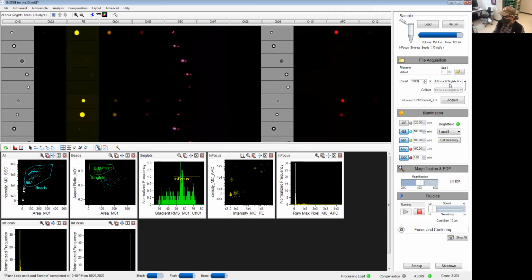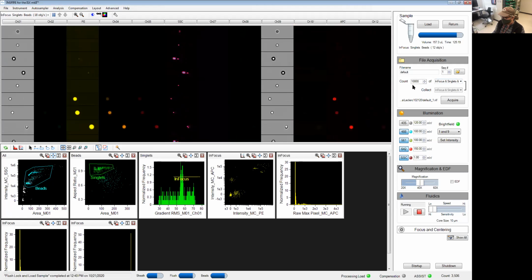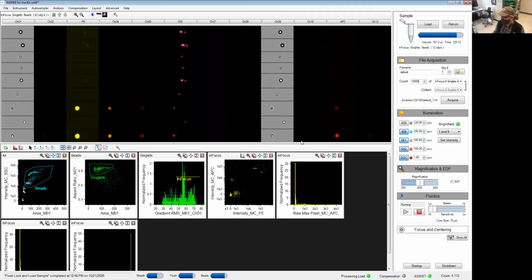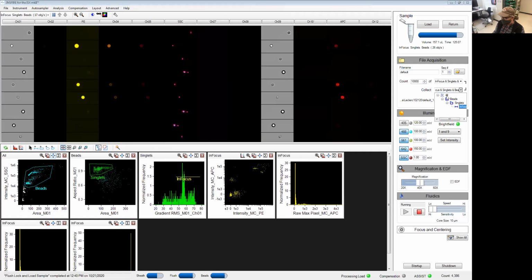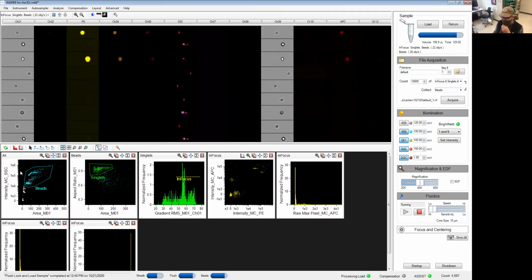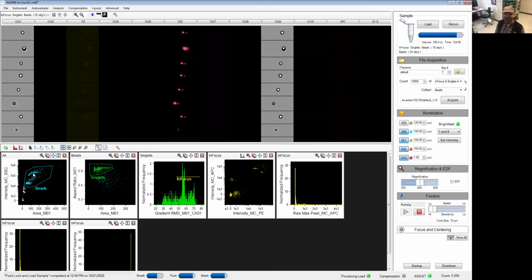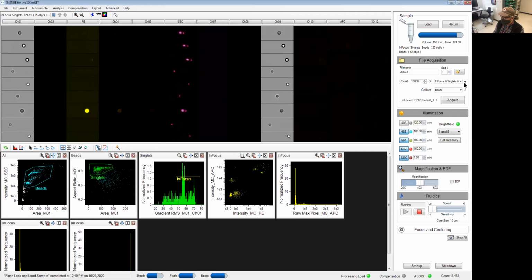Collect, since these two boxes are linked, we're going to count 10,000 events and stop acquisition, and save only what's in this region here. I don't like to throw away data at this point of the acquisition, so typically I'm going to either record everything or just the beads if I'm very sure that I'm not losing anything that's going to be useful later on. This used to be a problem where data storage was expensive. It's not the case anymore, so we don't really mind.